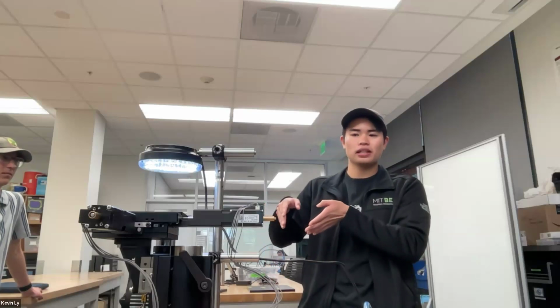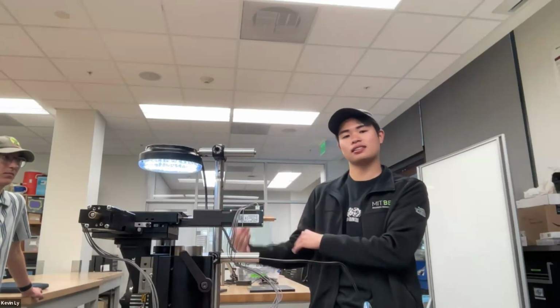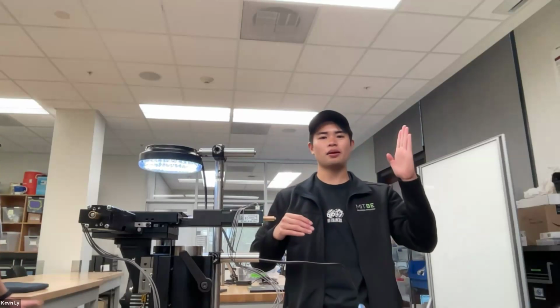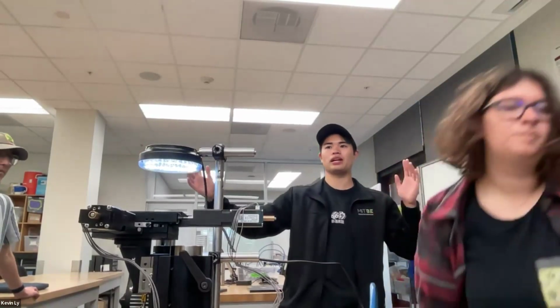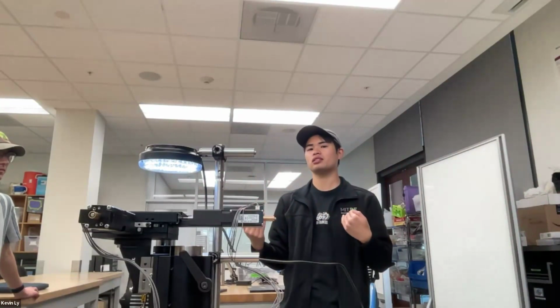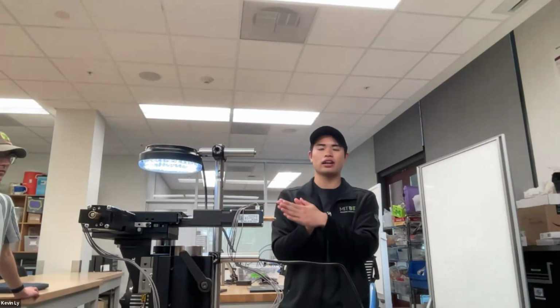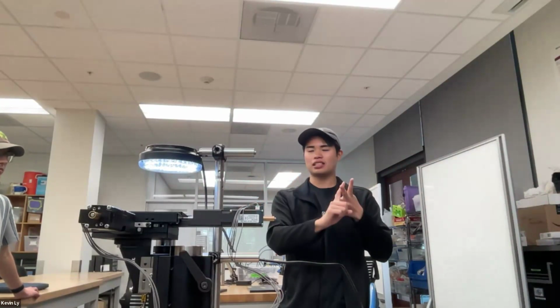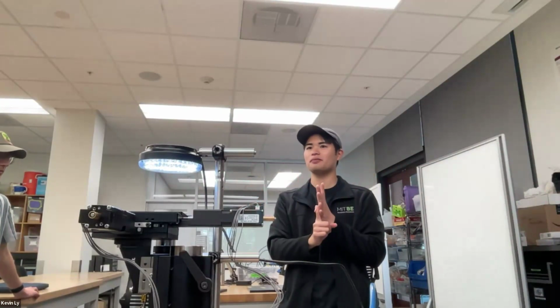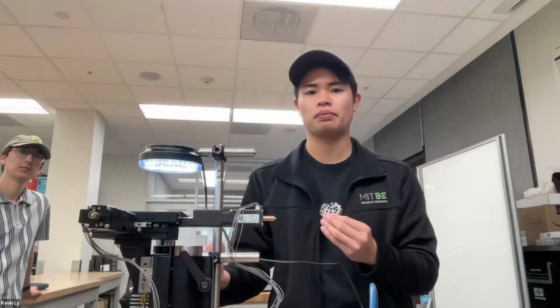So then the tube lens will focus the light again, and where we want it to focus is on the sensor of the camera. So you have object, lens, tube lens, camera. Those are the four main parts, right? Sometimes you see mirrors, but mirrors, if they're flat, don't actually bend the light other than redirect it. So if you can track those four parts, object, objective lens, tube lens, camera sensor, I think you can understand most of the basics of optics.